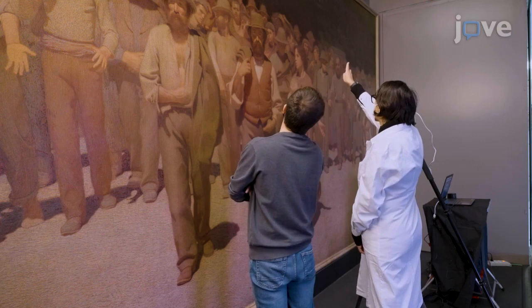With the support of art experts, perform a preliminary inspection of the painted surface to identify the main features of the painting.